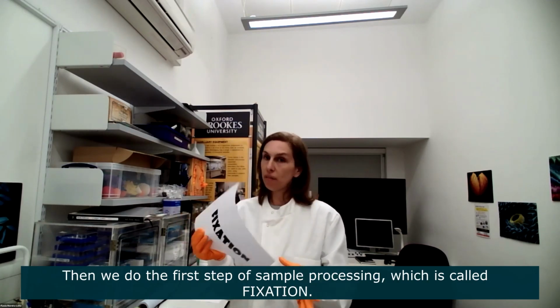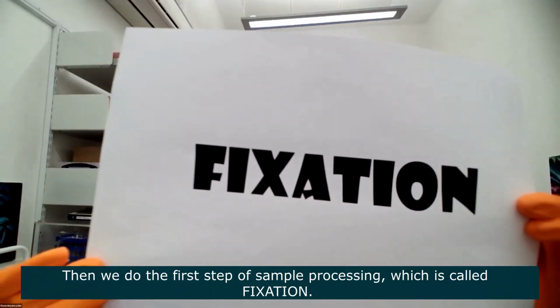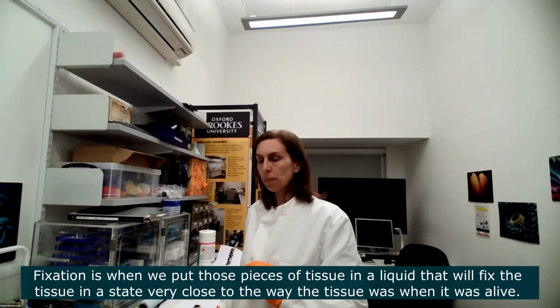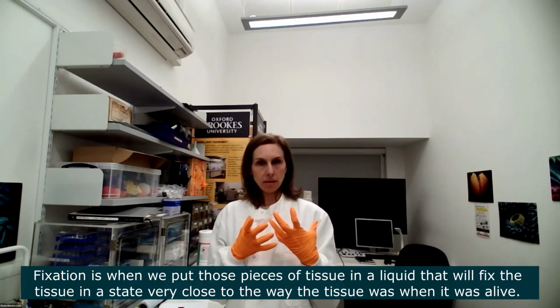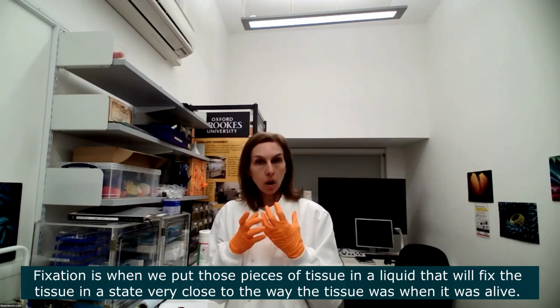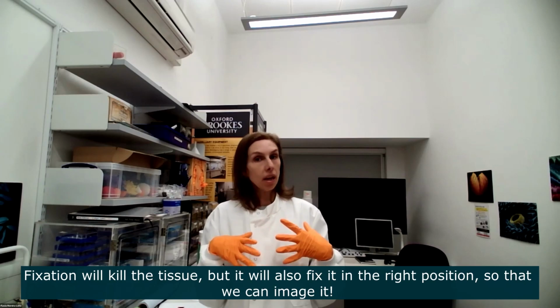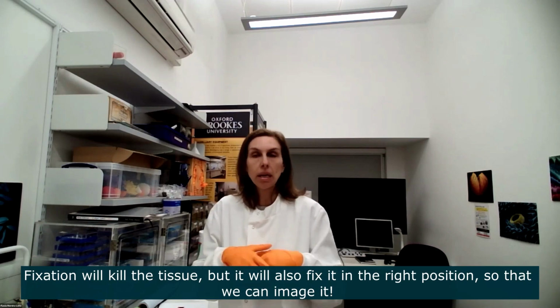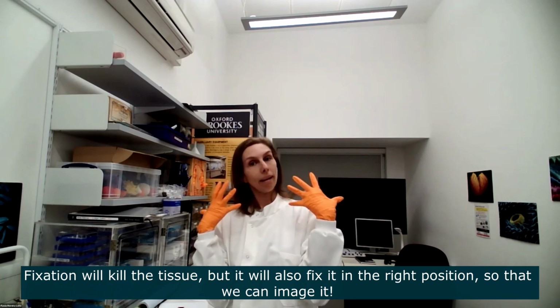And then we do the first step, which is what we call fixation. So we put that little piece of tissue in a liquid that will fix it in a state that's very close to the way the tissue was when it was alive. So fixation will first kill the tissue, obviously, but it will also fix it in the right position so that we can then image it.